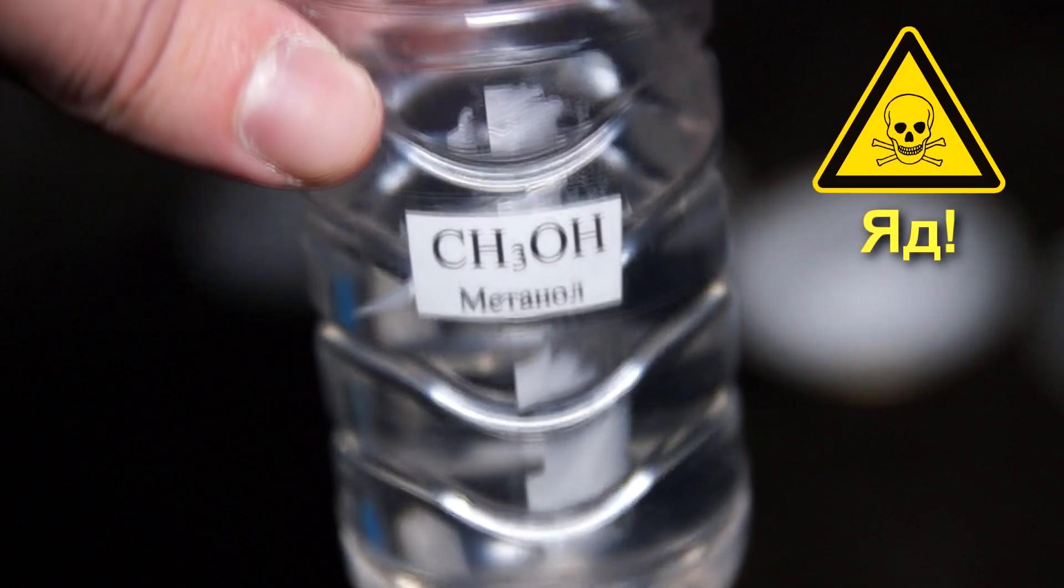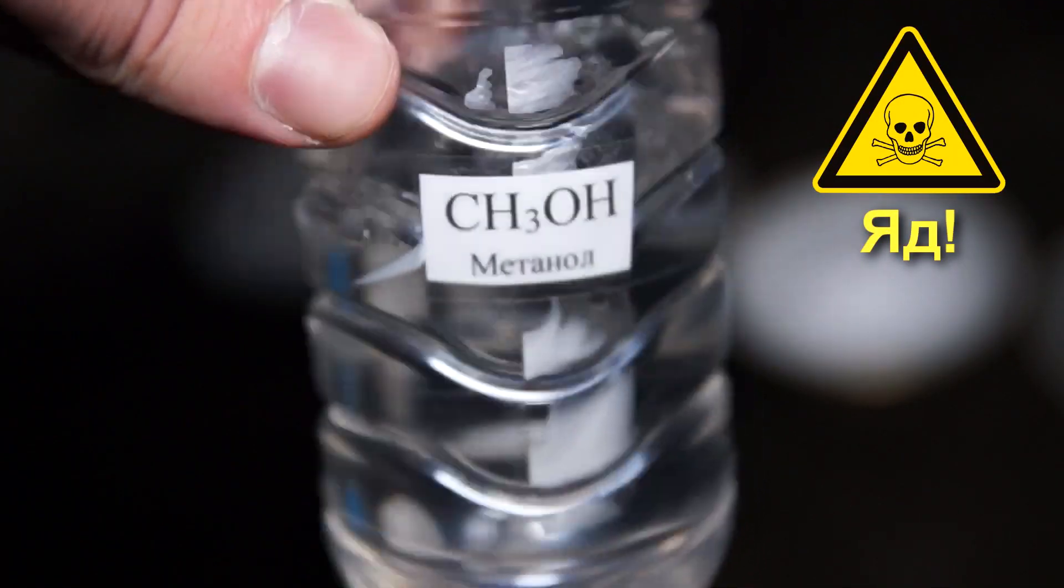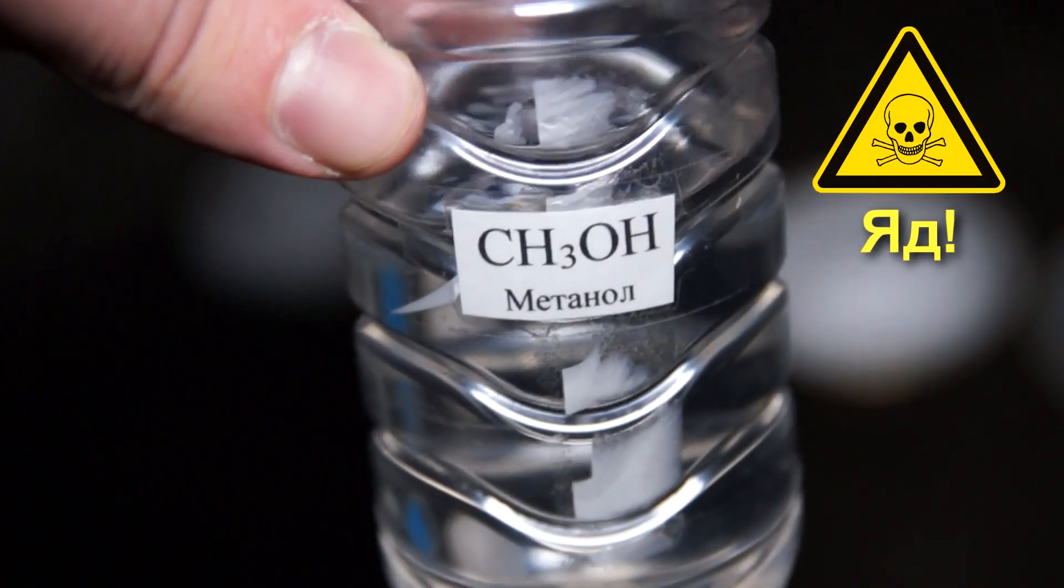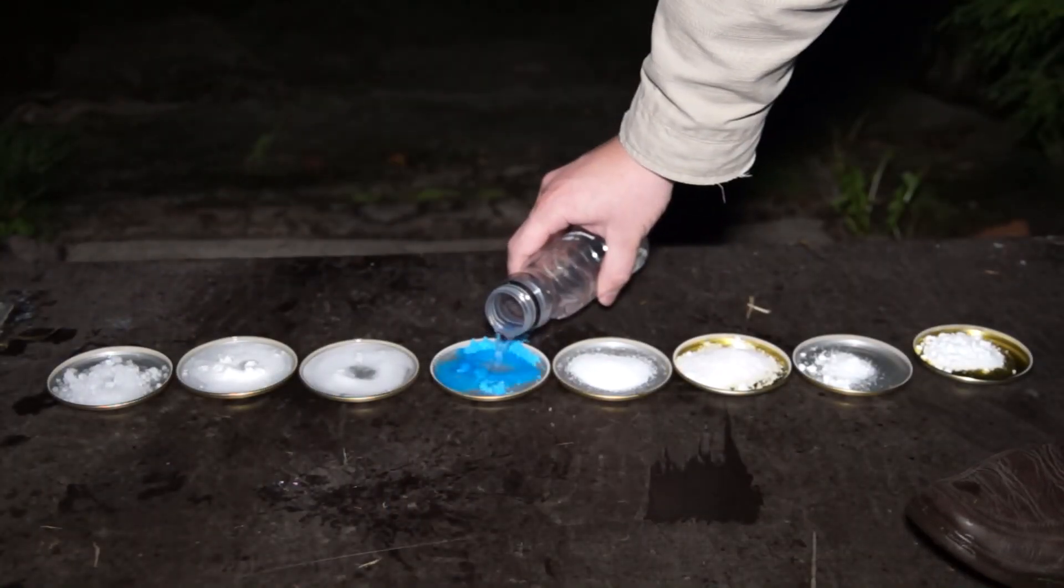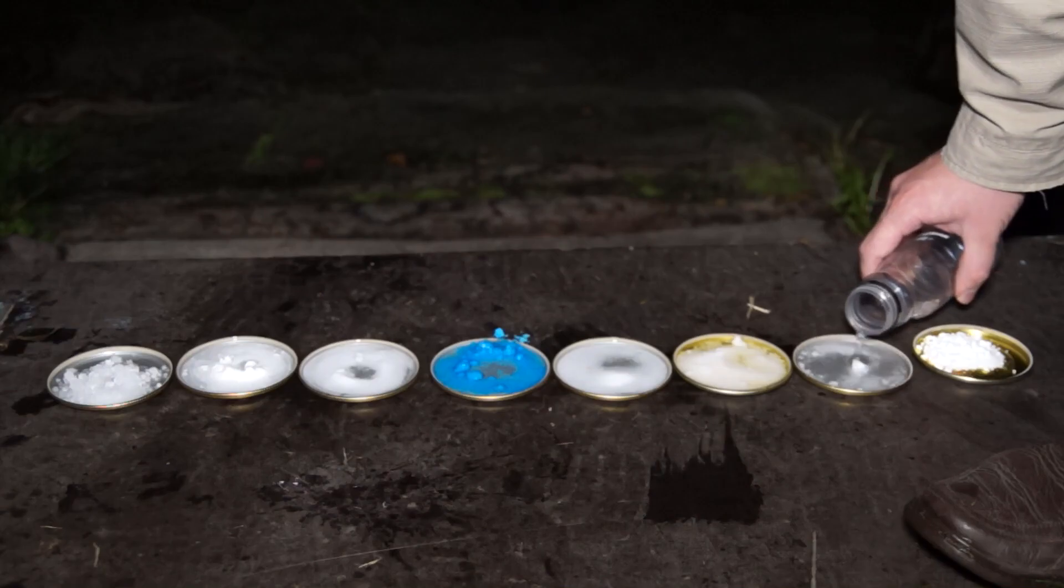To achieve the best result of transferring the color during combustion I use methanol as a fuel. I'm pouring a small amount of methanol into each of the cups. Next I set fire to methanol.